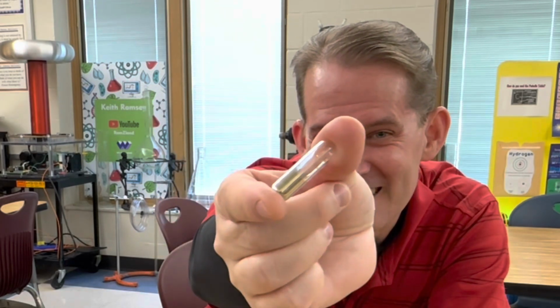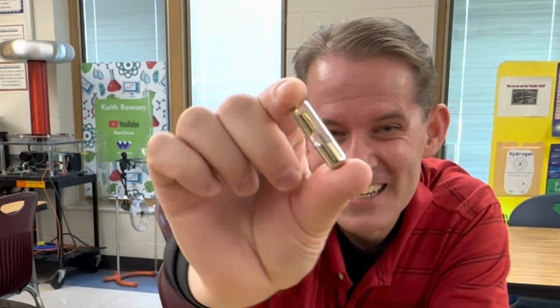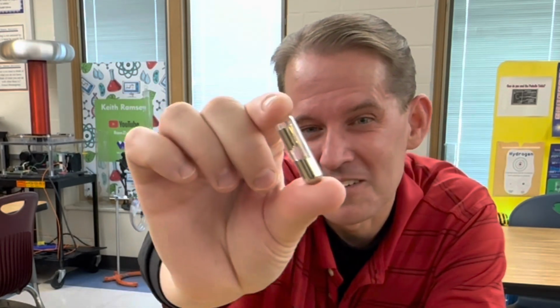Isn't that fantastic? So once we have the cesium safely in the mineral oil, we'll take very small amounts of it. I think we'll add some to water to synthesize cesium hydroxide, and then we'll take a very small amount and add it to molten sulfur to make cesium sulfide. And I think that you'll find that rather spectacular. Look at the cesium move through the ampule. Just a beautiful alkali metal.